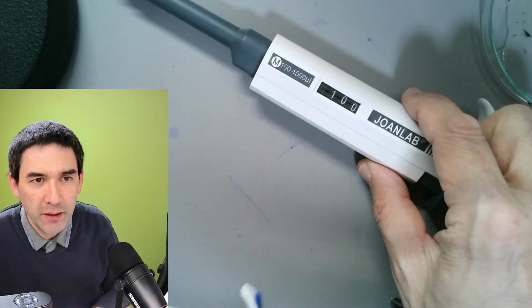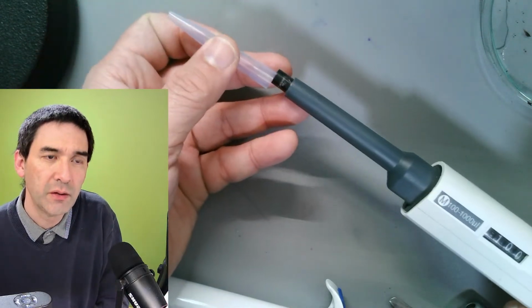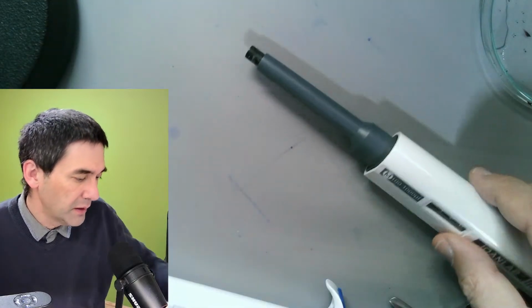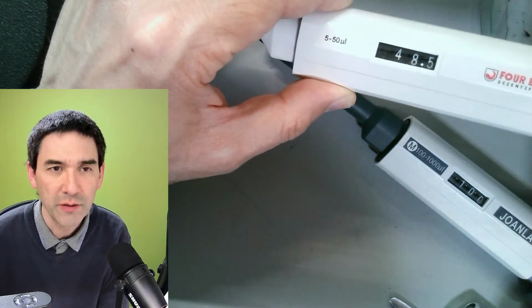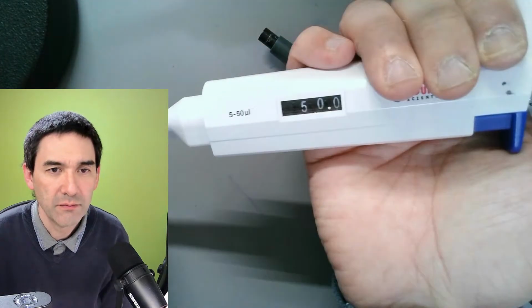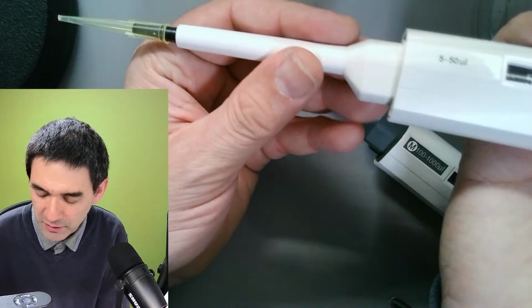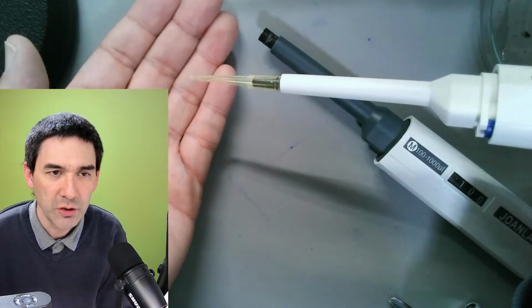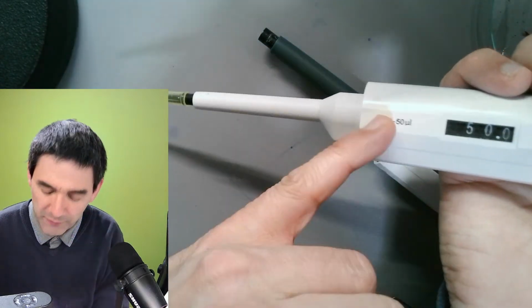I first bought the 1 milliliter pipette, and I found it too big. Of course, I can also make the volume smaller, but I then decided I'm just going to use the 5 to 50 microliters, because I can adjust it here anyway. So I'm perfectly happy with this one, and also the smaller tip sizes fit. These were actually quite cheap ones. Maybe not the best quality, but good enough. And by the way, by pushing this one here, you can throw off the tip. So I personally can say I'm happy with the 5 to 50 microliters.